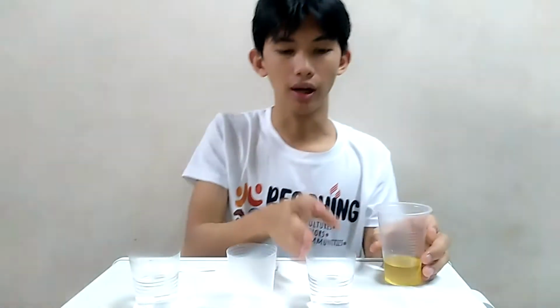So let's do it. The first thing that I need to do is to drop amounts of oil into the different kinds of solvent. Let's start with our plain water, or the water at room temperature.